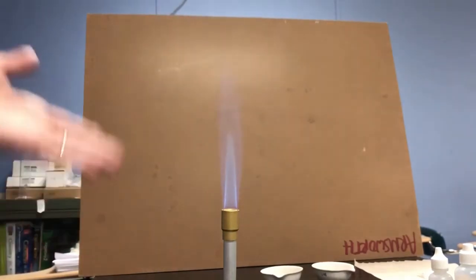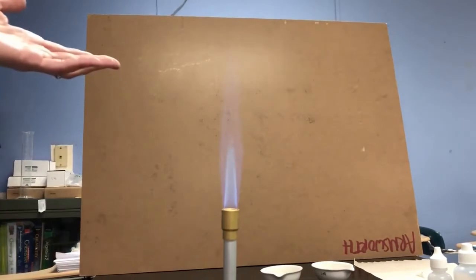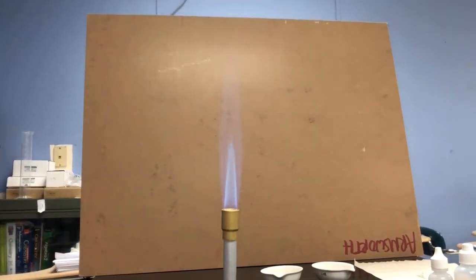So it's reacting with something in the air. The air around us is also colorless. It's reacting with something in the air that's causing it to burn. And you should know what gas in the air it is reacting with because you did your background reading, and you know that burning is a particular kind of chemical reaction that involves an element that you find in air.